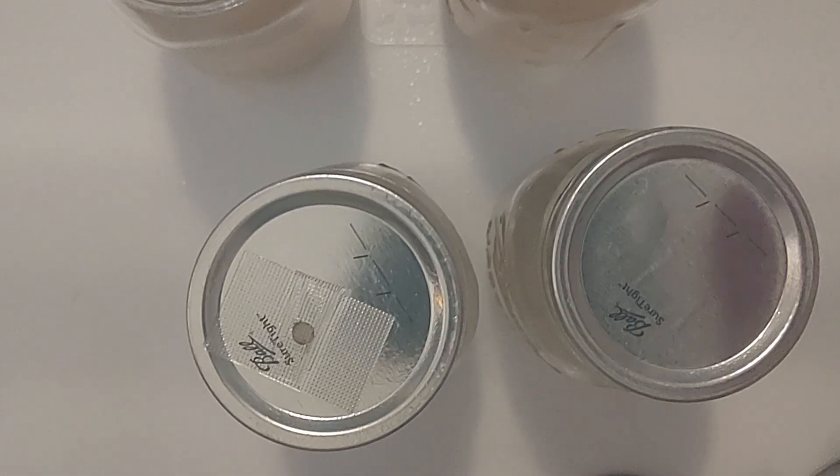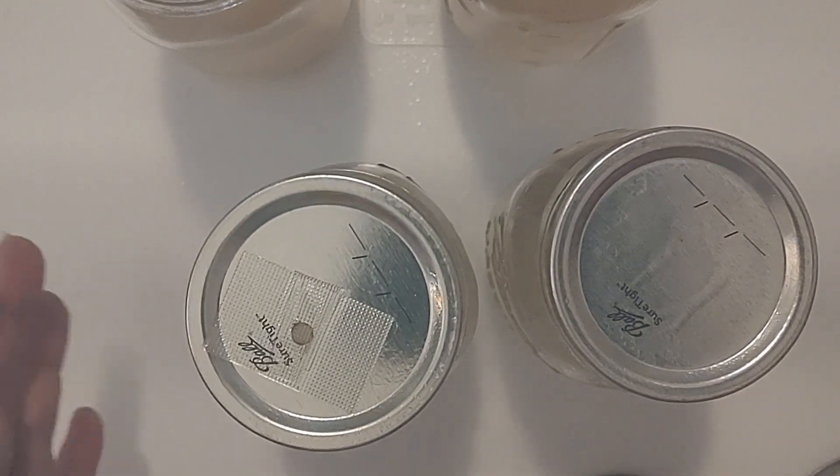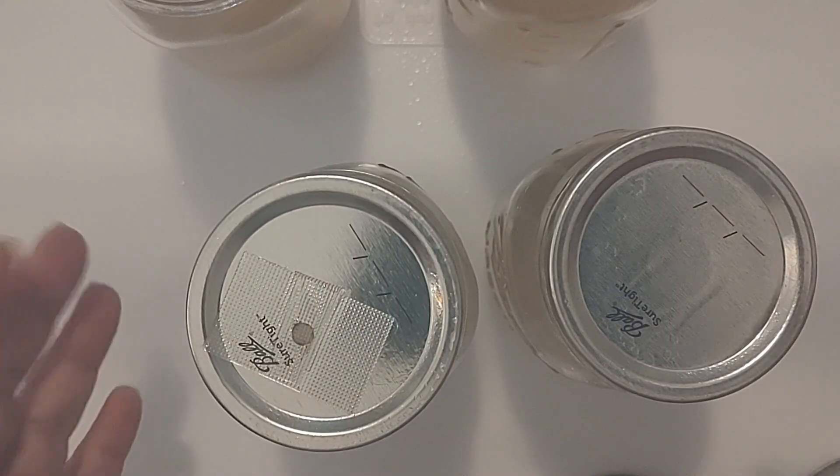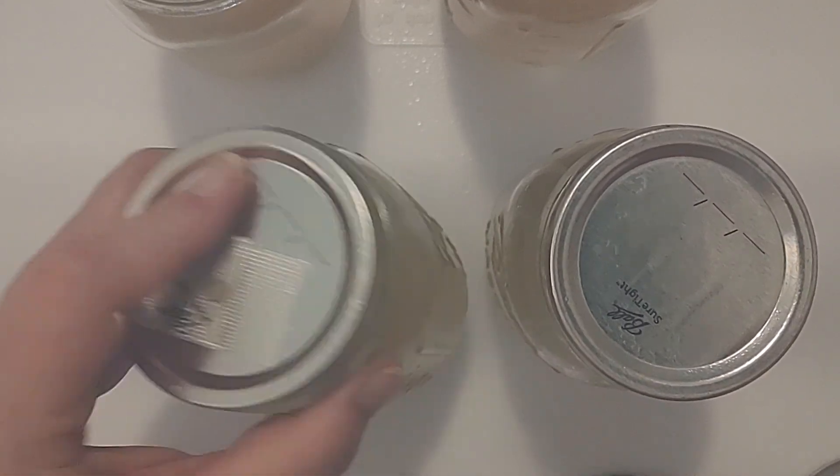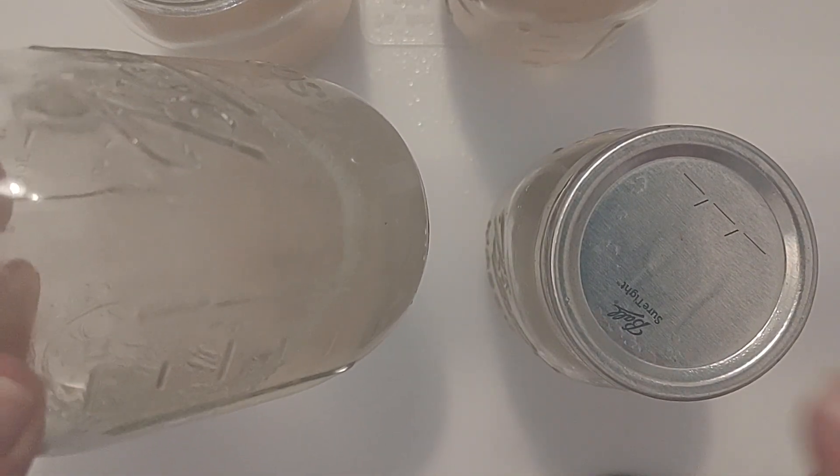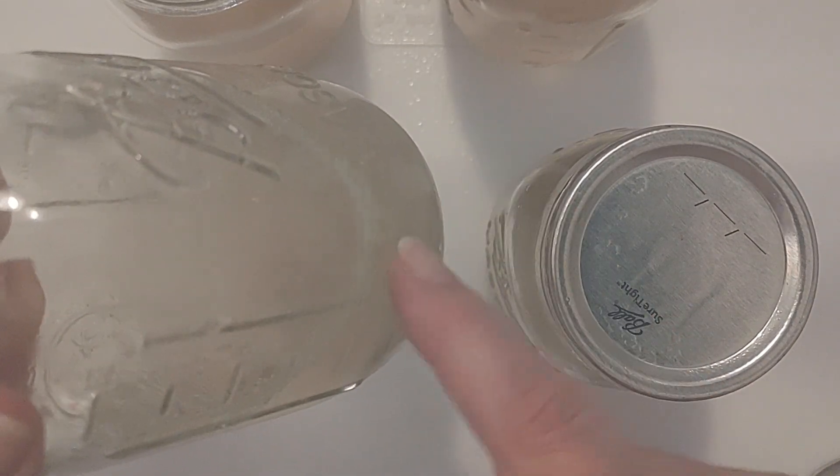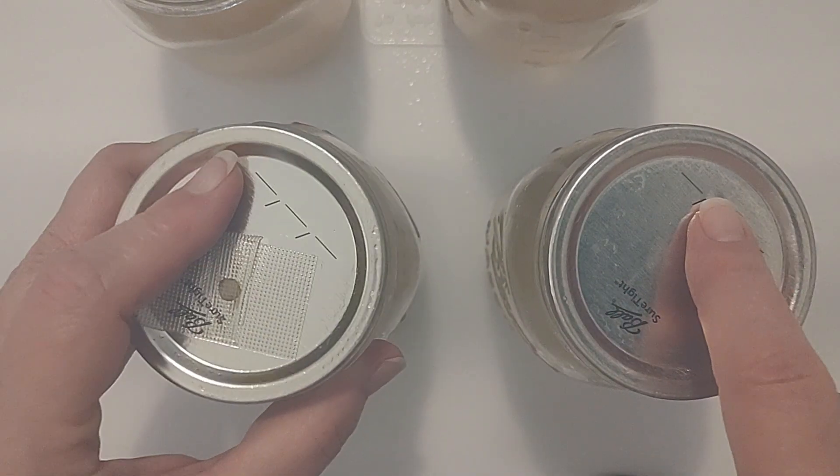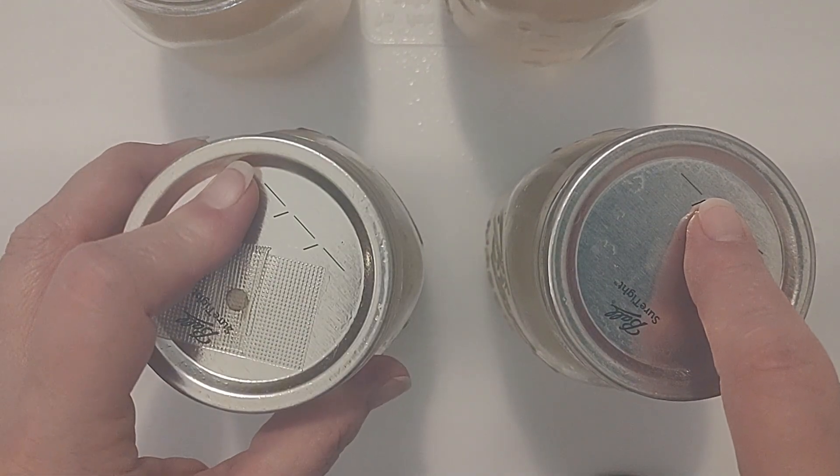So these experiments are amazing and we don't have to waste when this didn't work out for us. We can just grab a syringe of the mycelium and move it to a liquid culture.